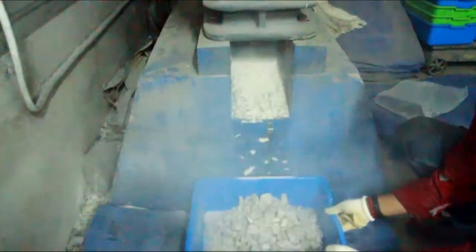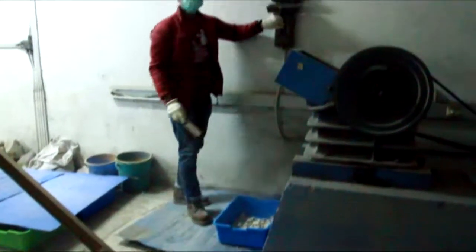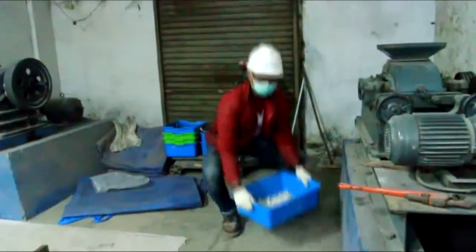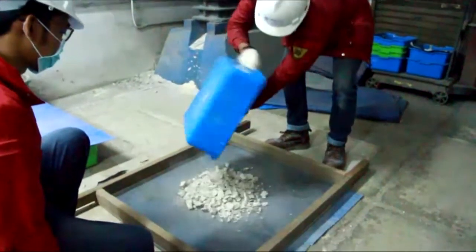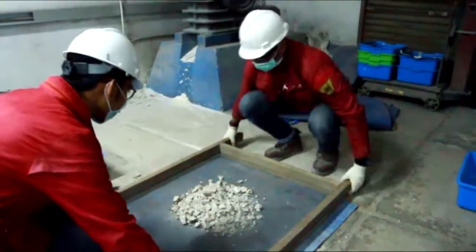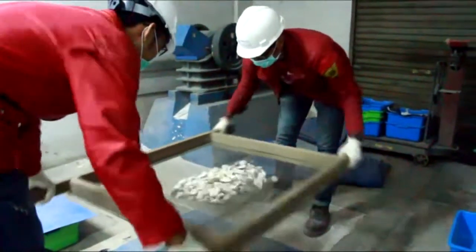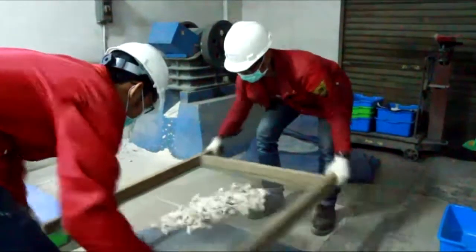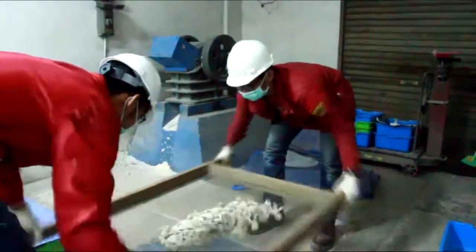Grinding, crushing, and grinding is a match which tests the participants' skill and knowledge about the comminution process in laboratory scale. There are four stages in this game: primary crushing by jaw crusher, secondary crushing by roll crusher, grinding by ball mill, and screening by vibration screen. The aims are: one, participants are able to reduce the grain size of material from the size of a boulder to the size of medium sand through particular processes of crushing, grinding, and screening using laboratory scale equipment; two, participants are able to make a PSD (particle size distribution) graph and define the P80 value from the screening result.